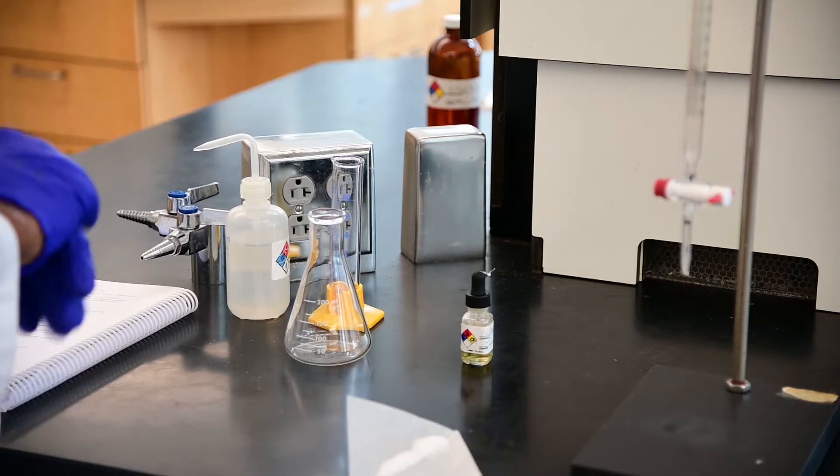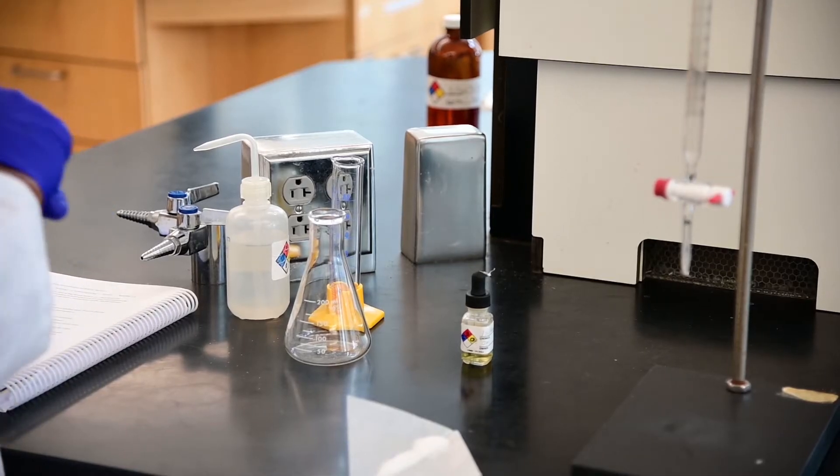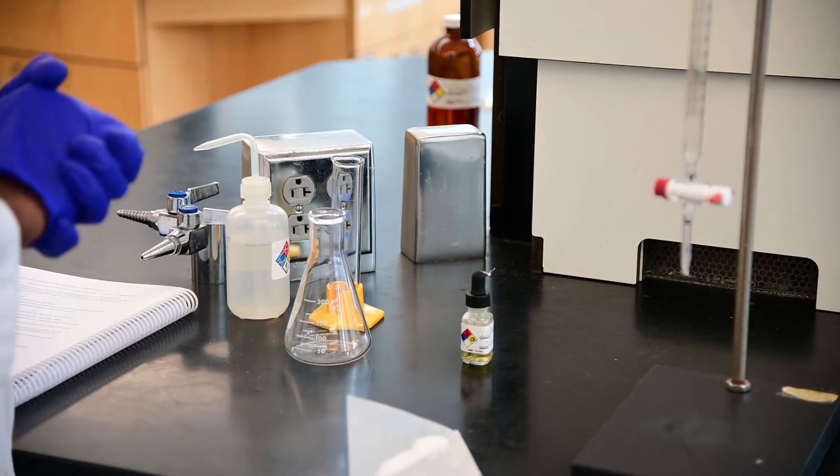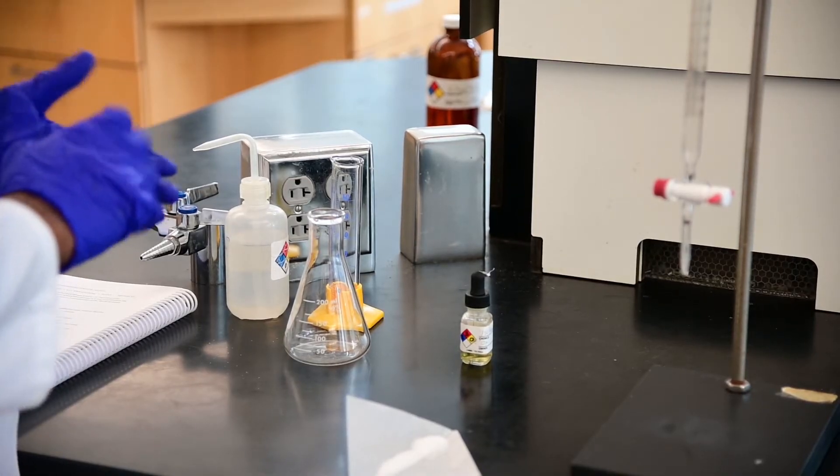Okay, this is the acid-base titration lab, and I'm going to show how this lab would work.